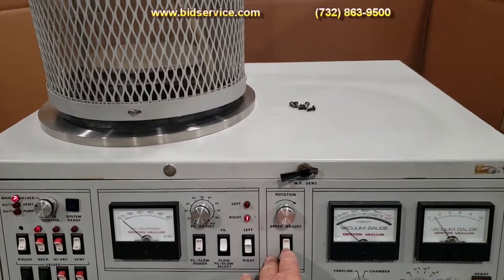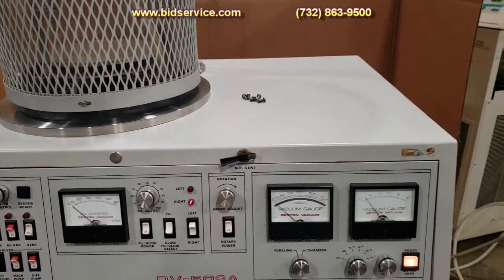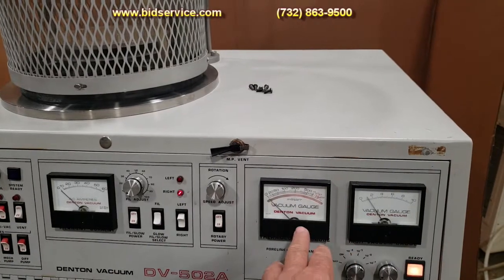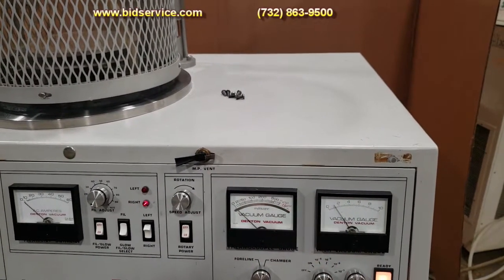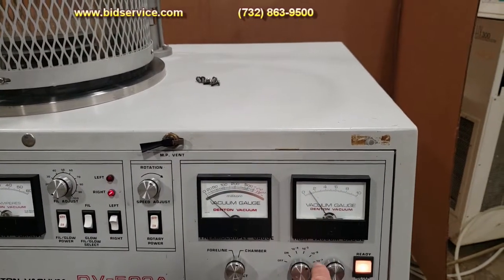and we only have the right side working. On top of that, here you have your rotation. Over here are your vacuum gauges - this is for your fore line and chamber, and this right here is your high vac. As you can see, the system right now is at one times ten to the minus six.